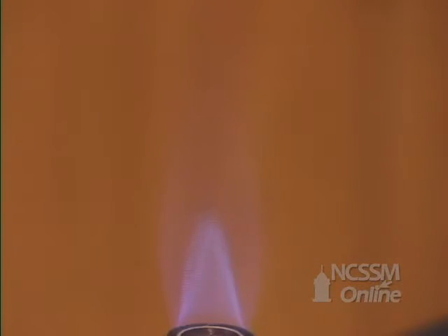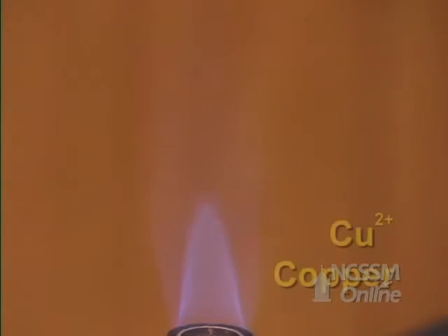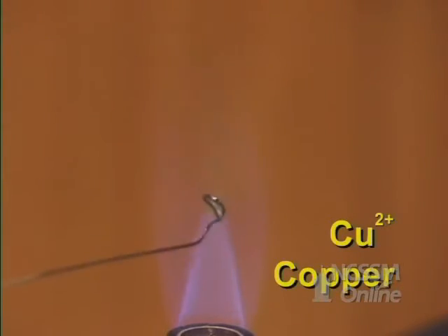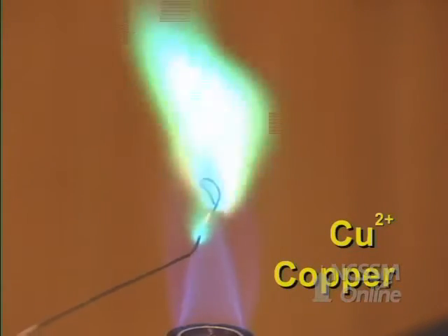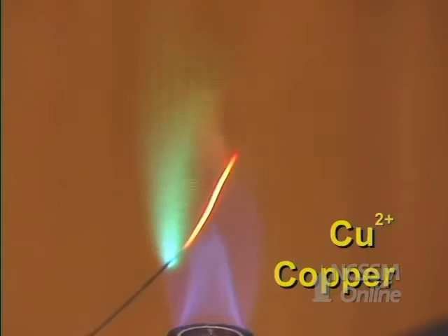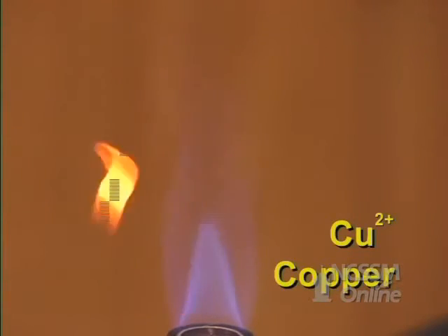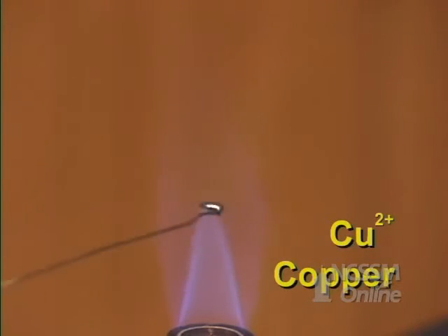And then the last one is copper. This is the most vivid of all of them. Nice green.